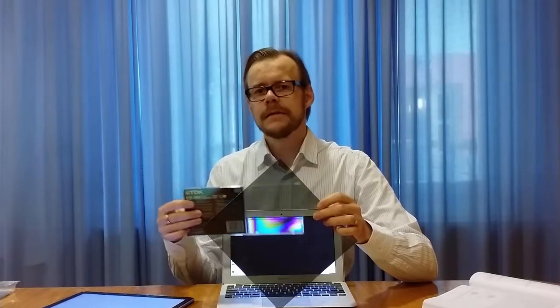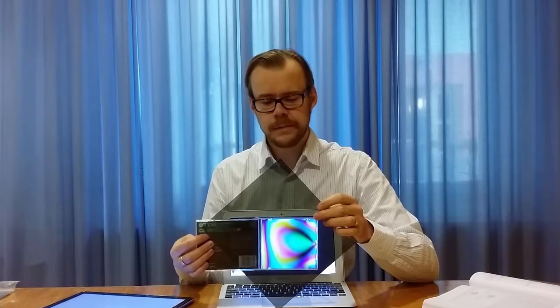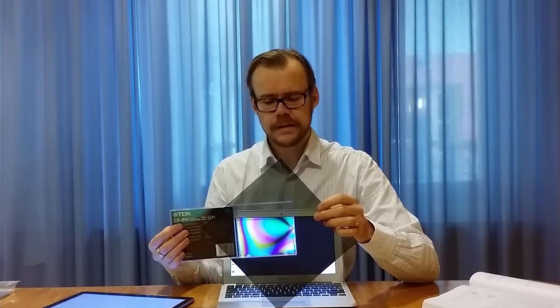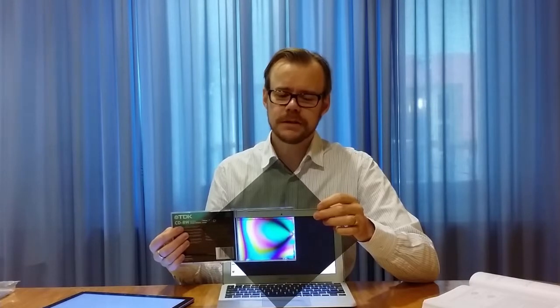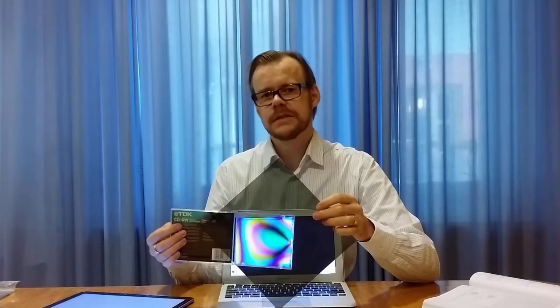So I will demonstrate that. Here I cancel out the light like so, and then I put in this little piece. Now you see all the colors of this CD case, and the bending curves of the colors you see, especially towards the edges, is an indication of stresses in the plastic. You can also do this on glass, for example. It will not have color then, but you will see some bright rings where you have stresses in the glass.